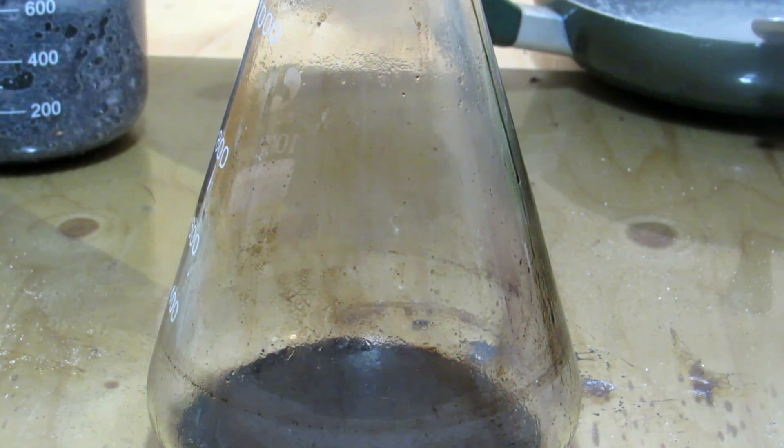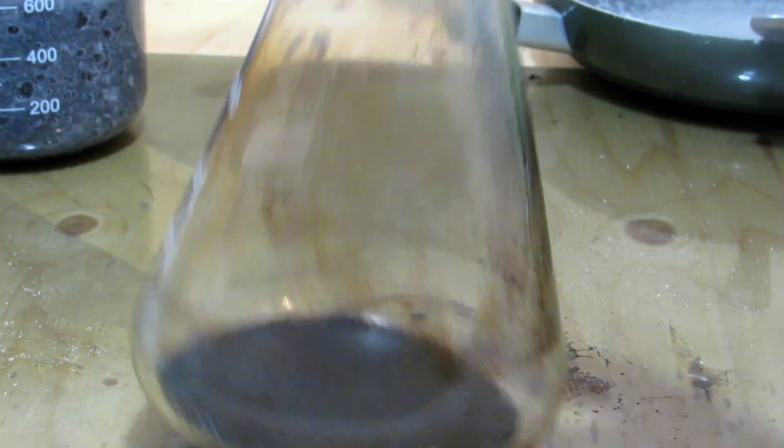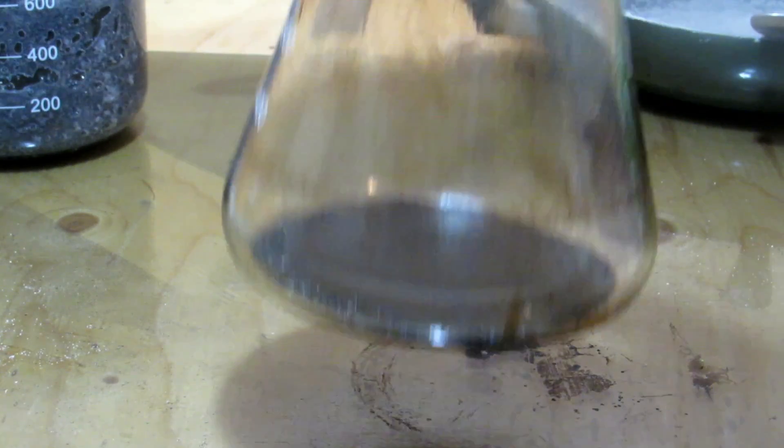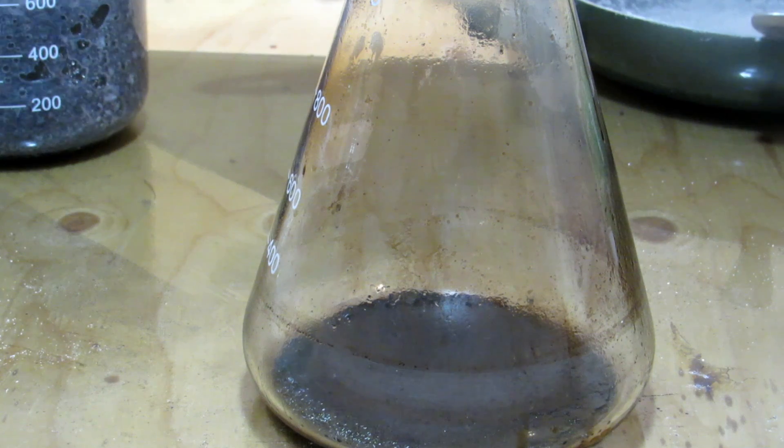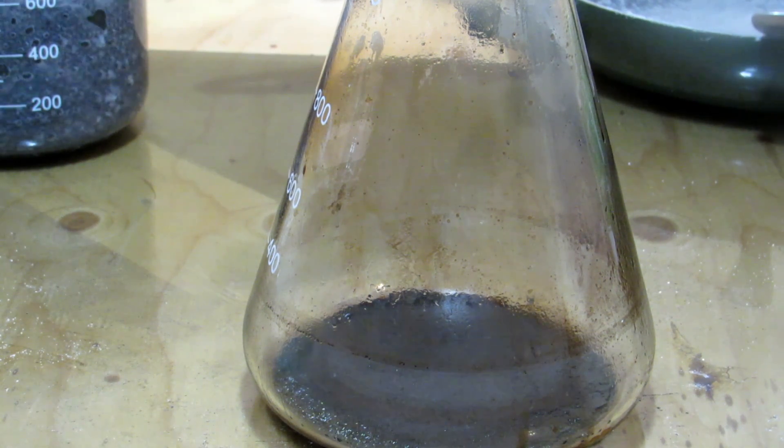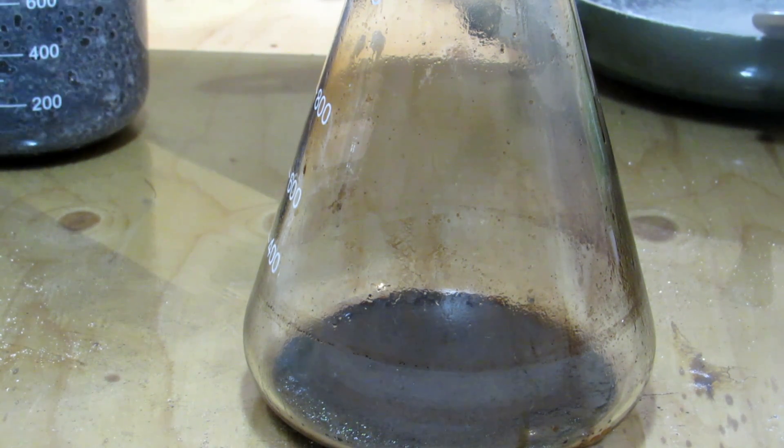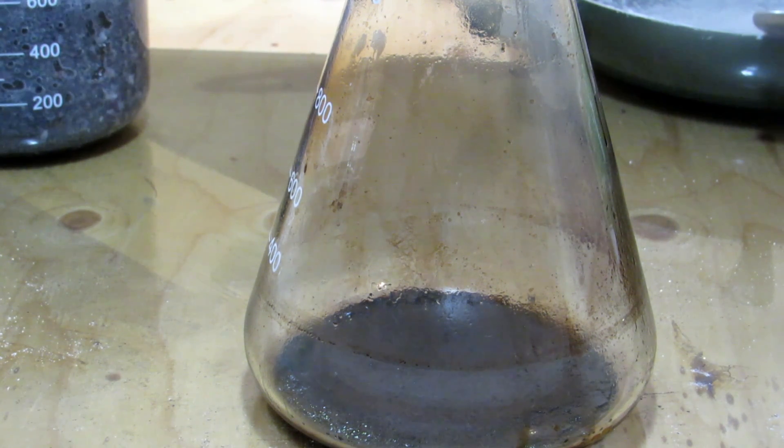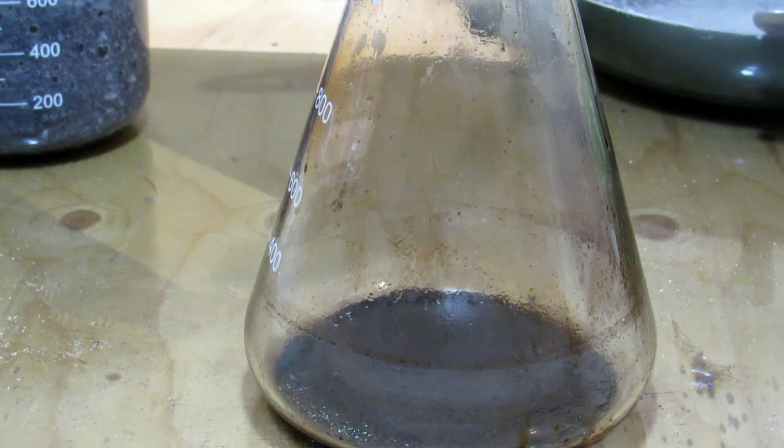After distilling off all the dichloromethane, here's our crude caffeine. It actually smells really horrendous. It has some sort of organic impurity, which is just disgusting. We need to now purify this.